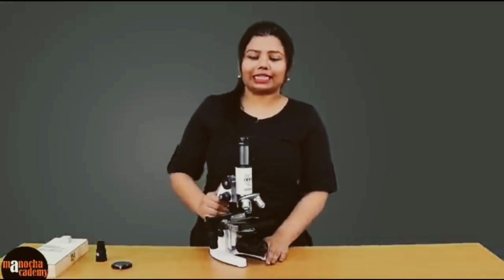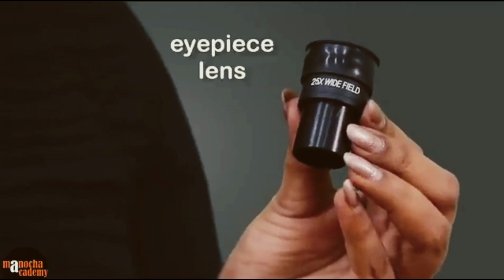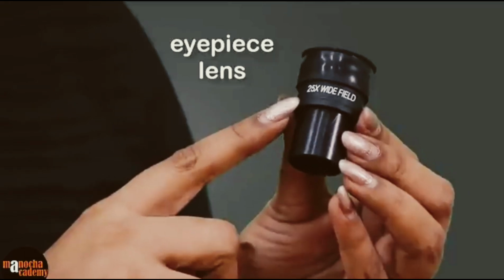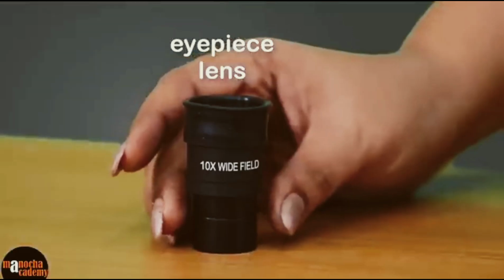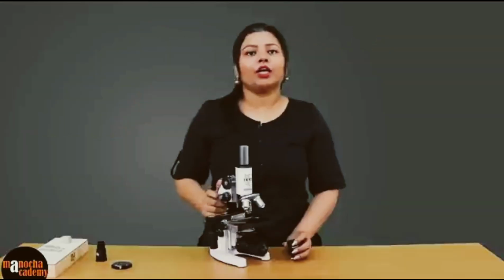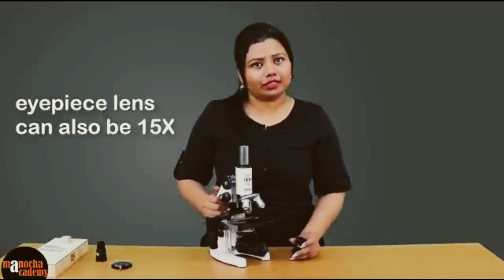The first lens that is attached to the body is the eyepiece lens. If you see closely, the eyepiece lens has a certain magnification, which here is written as 25x. You may have an eyepiece lens which is 10x, that is, it magnifies the image 10 times. You may also have an eyepiece lens which is 15x, which is magnifying an image 15 times.